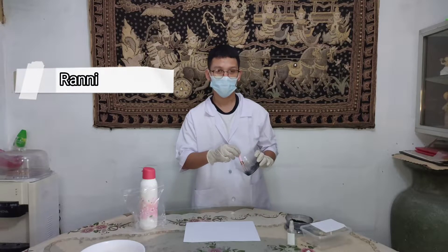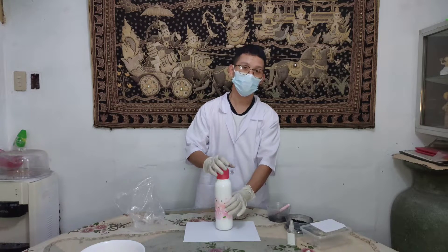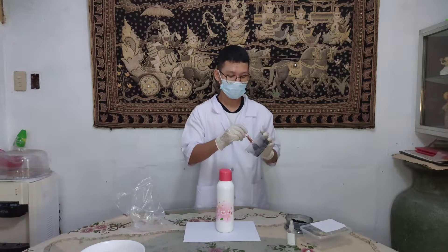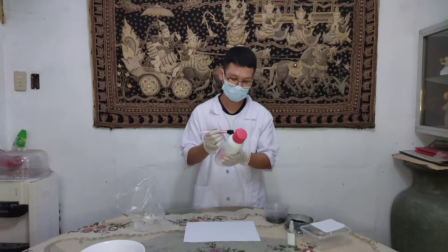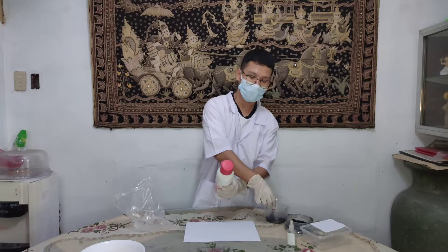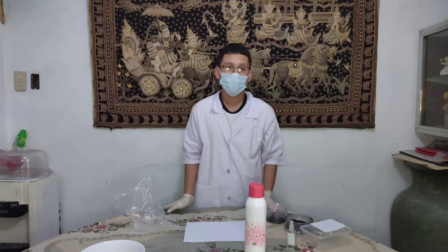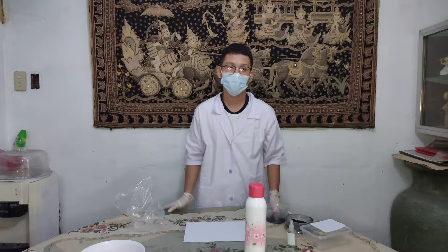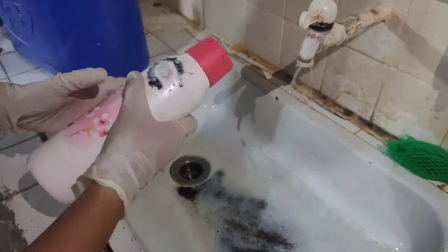After mixing the mixture, we're going to place the evidence on a flat surface and look for the fingerprint impression. We will apply this mixture on the evidence obtained from the crime scene. After applying it, set aside for a couple of minutes to dry it off. After that, we're going to wash it gently on running water to remove the excess powder.